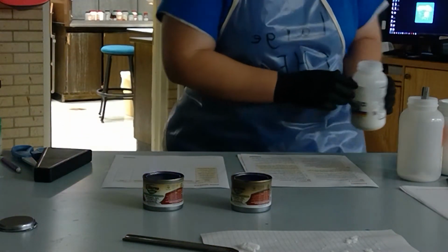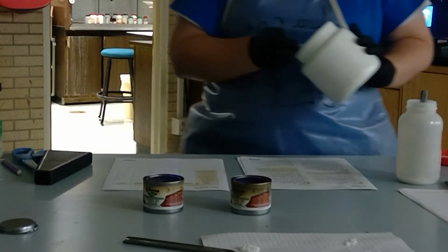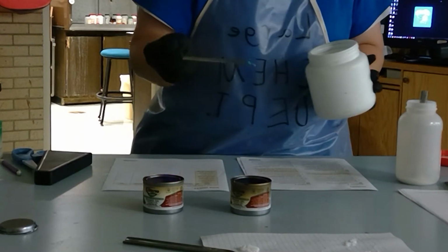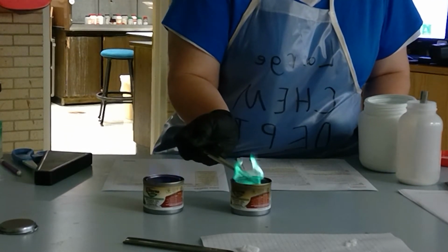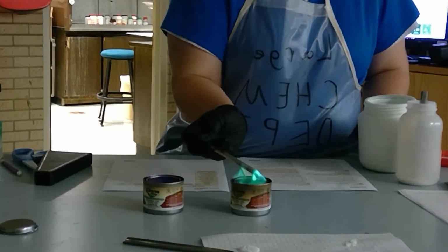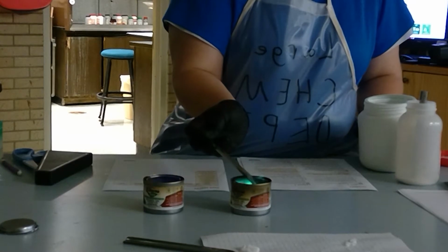So that's your first sample. I must have spilled a little bit of stuff in there because you can see that red flame. So now I'm going to take this next sample, and I'm going to stick it in this other sterno just to give that other one a chance to burn that red color. Notice that green flame, that bluish green color. Which one of the metals, potassium chloride, lithium chloride, copper chloride, or sodium chloride, would give you that green color flame?